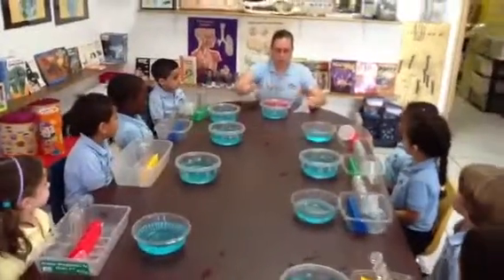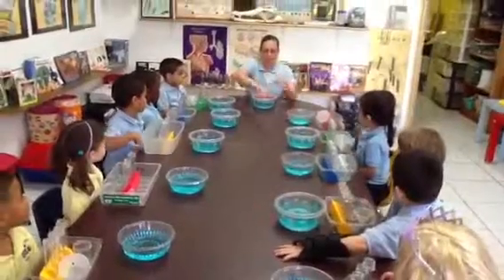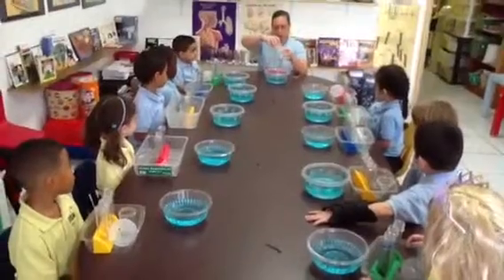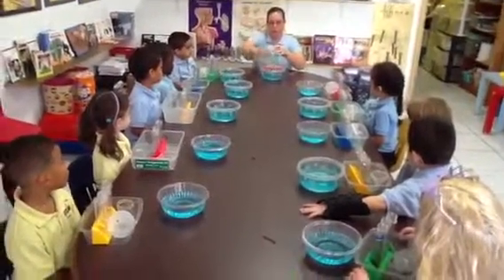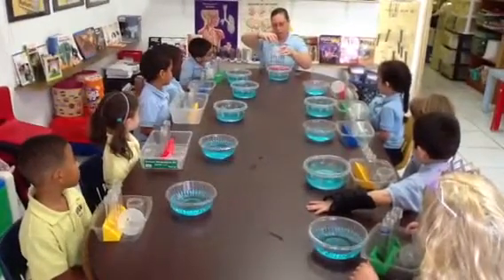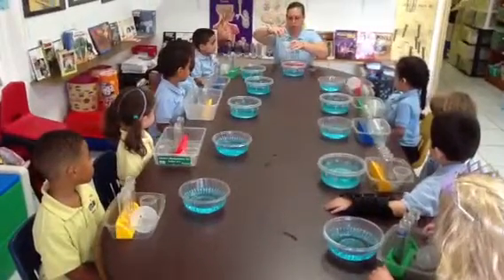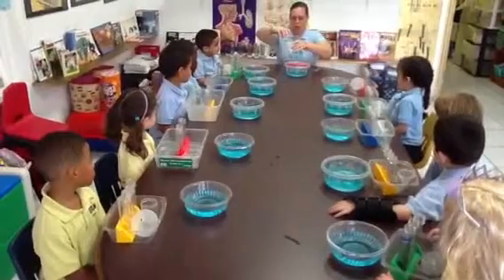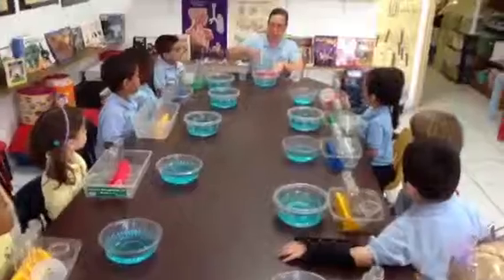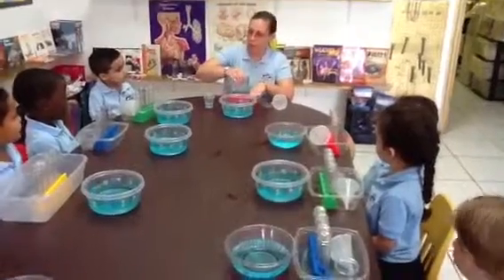Now I'm going to show you what you guys are going to do. I'm going to clear mine out. In a moment, you're going to put your funnel in the first one, you're going to pour — pour up — stop. You're going to get more water, pour the second one, and then pour the third one. When you finish, you're going to hold this, take it out and empty it, and then try it again.